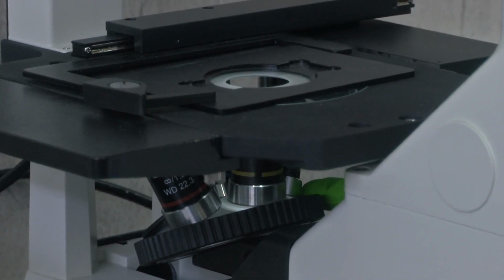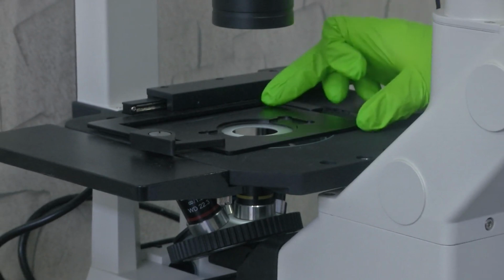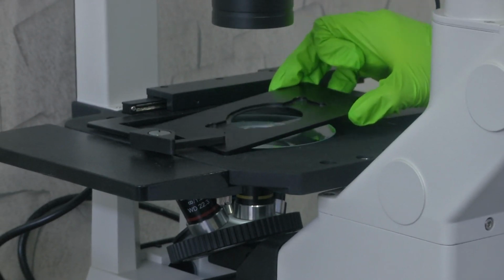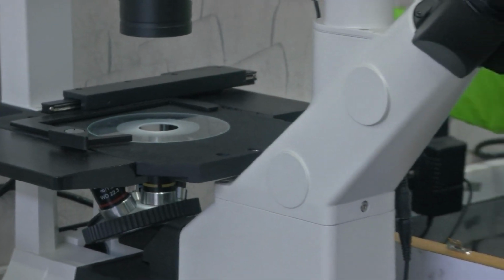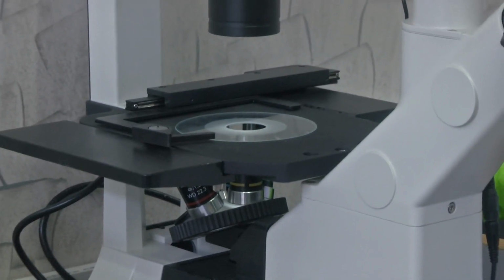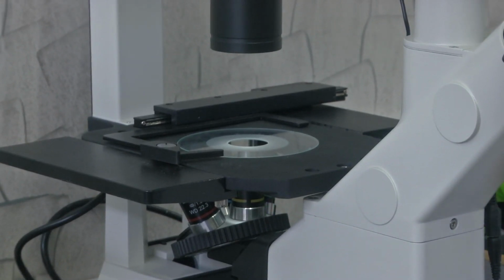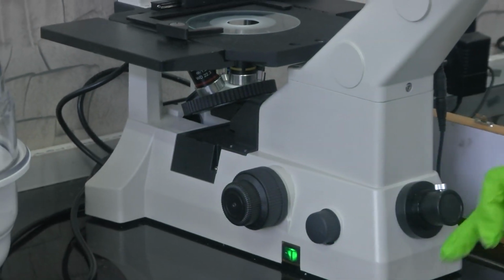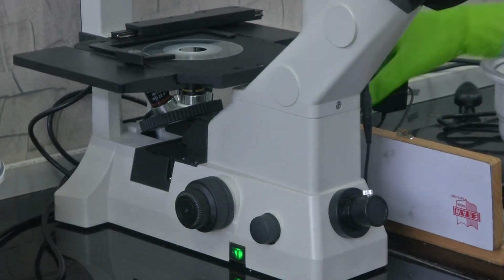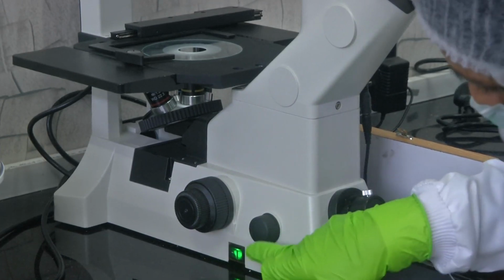Now that we have seen how the turret sits in case of an inverted microscope, this is the stage and this is the sample holder. Like the previous one, the stage has knobs. You could move it to the right along the x axis, or move it along the y axis. Let me just demonstrate. It could be moved also in the z axis. This way your stage can be adjusted, and these additional knobs here are for adjusting your focus. Once your magnification is fixed, you could adjust your focus using these knobs which are on both the sides, for coarse and fine tuning, and the light source and the switch.